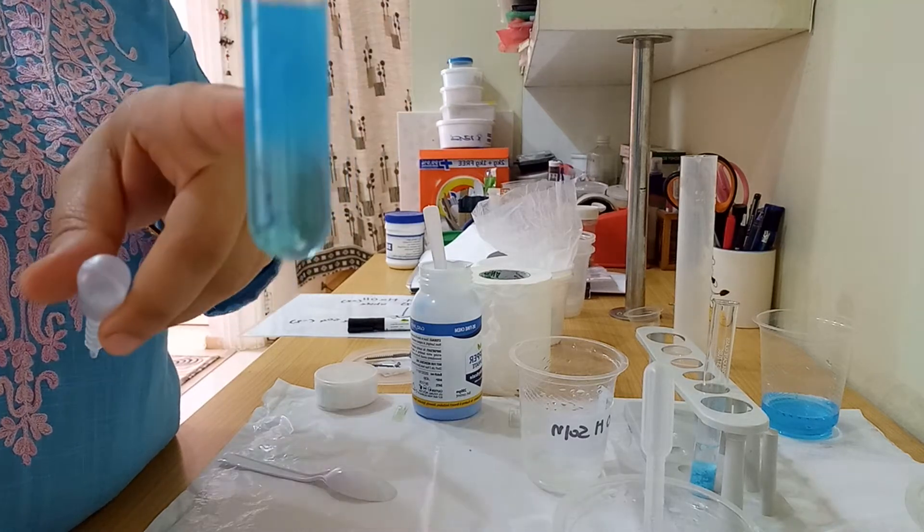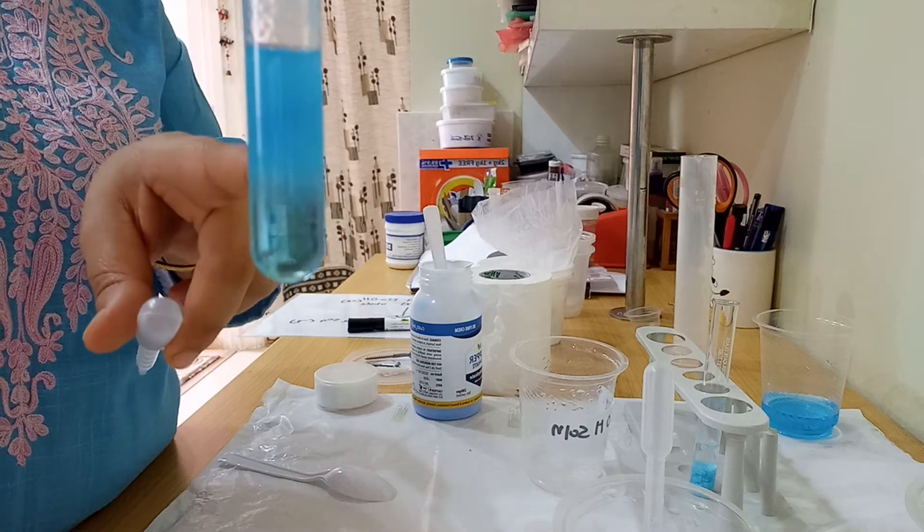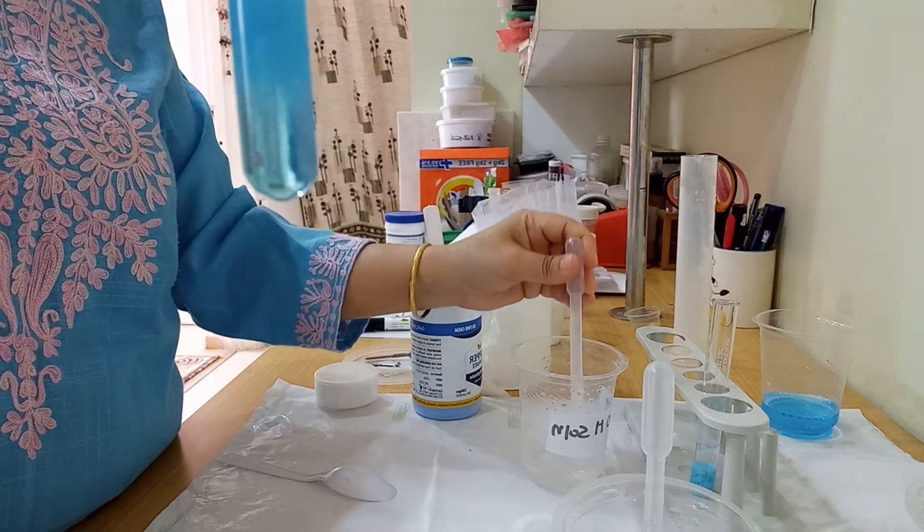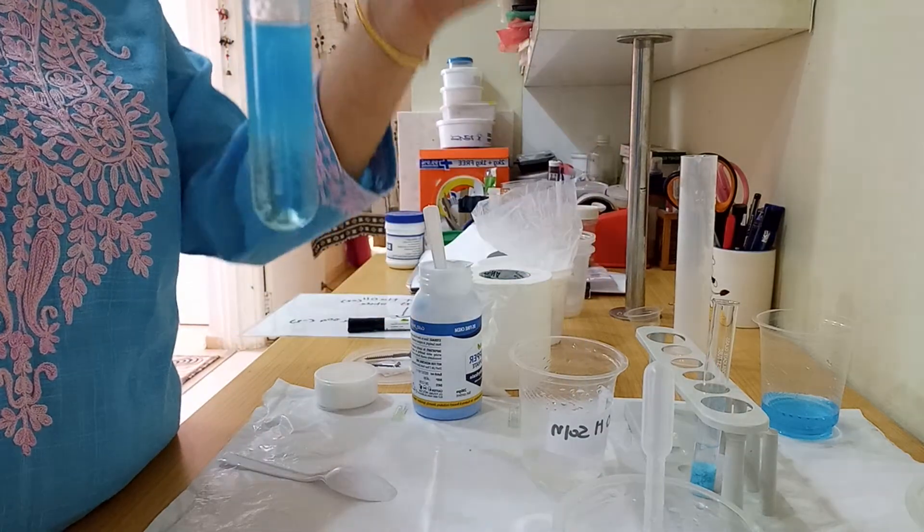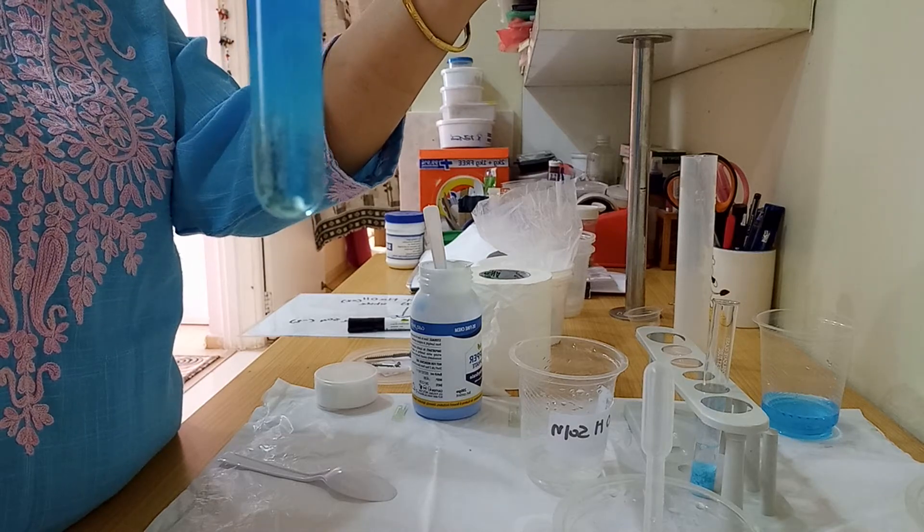Initially you can see it at the top of the solution. If you keep it for a few minutes, it will settle down. This kind of precipitate is called gelatinous precipitate. Let me add more sodium hydroxide.